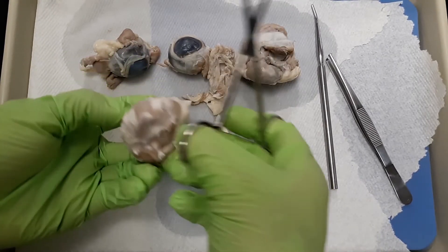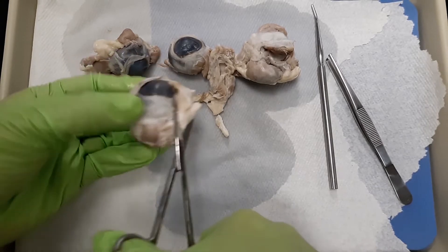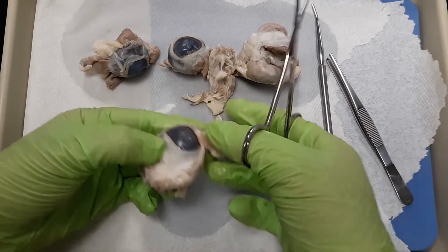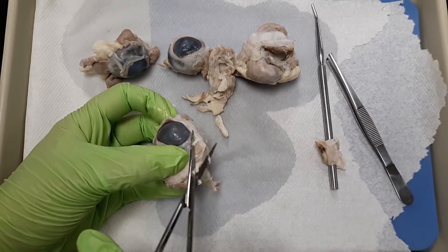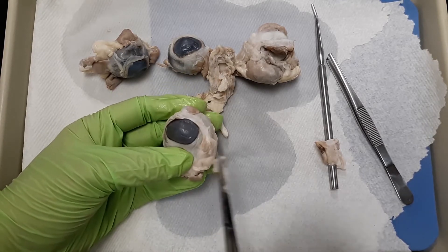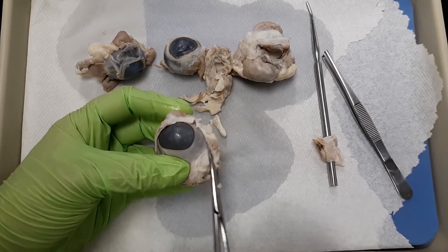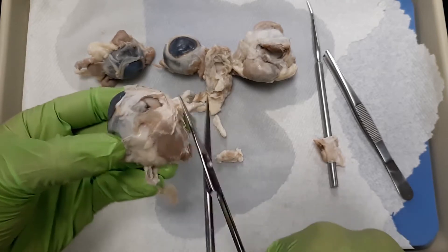When you're cutting, remember this is the inside of that lid — you're cutting around, not just stabbing into the eye. Start down here on one end and grab and chunk it off while still keeping that spherical shape of the eye. You're not cutting into the eye; you're just shaving it off — shaving off the fat. Notice I'm getting to those four eye muscles now; they come back and attach here where they would attach inside the skull. We're going to keep cutting some of this adipose — those are the fat white bits. These eyes put off a lot of vapor, so please make sure you have your safety goggles on.